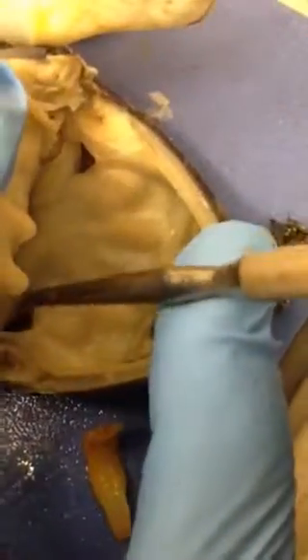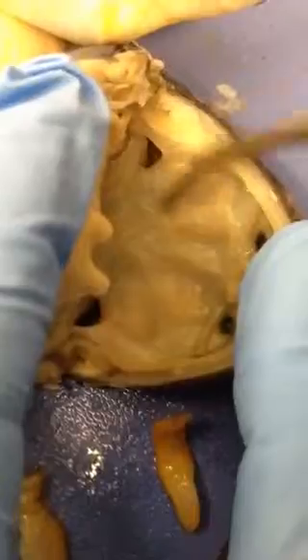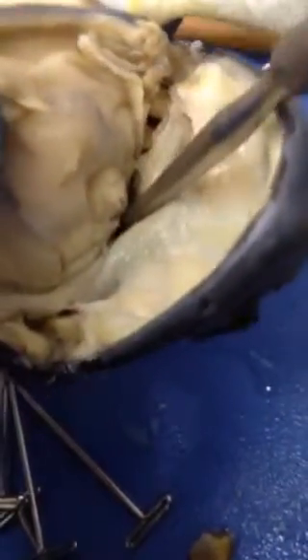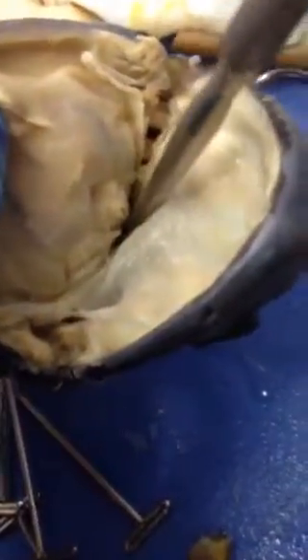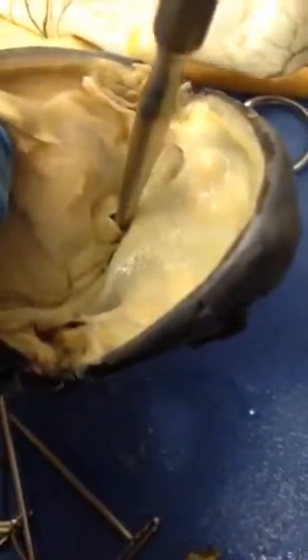This hole right here is the eustachian tube — it leads to the tympanic membrane. This is the tongue. Just for reference, straight back this is the esophagus, but this is the glottis, which leads to the lung.